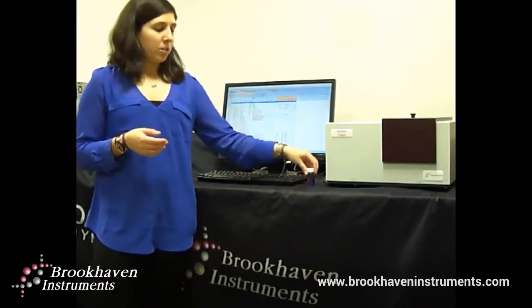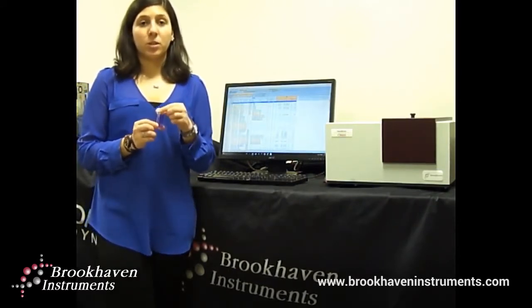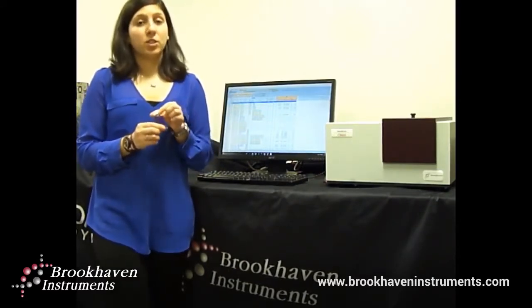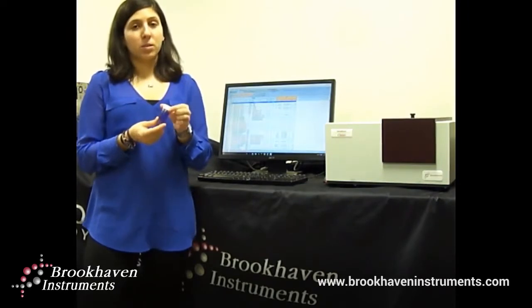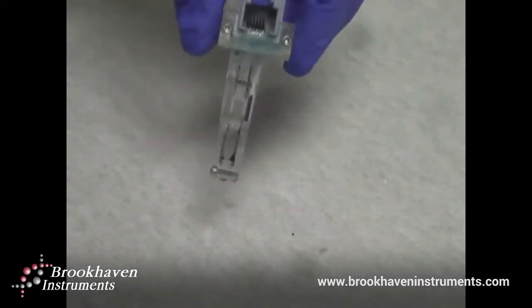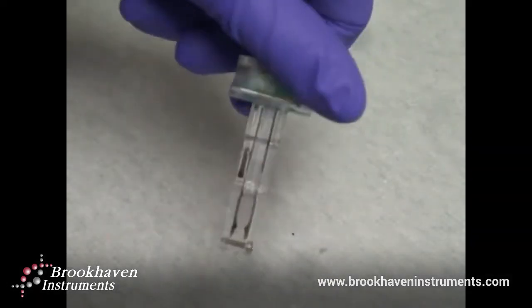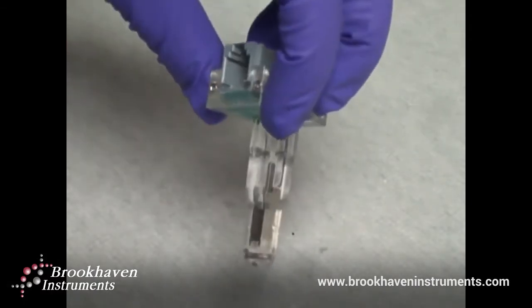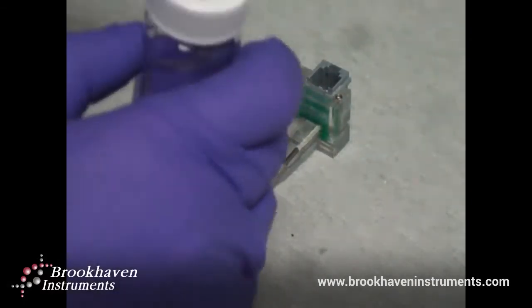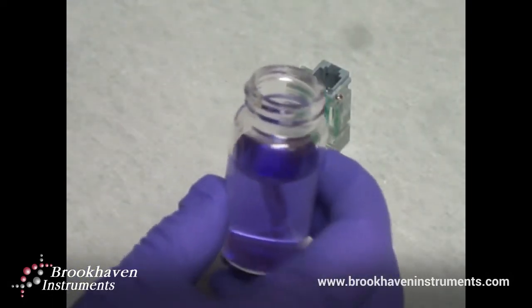Prepare a sample. First, I will be measuring a negatively charged reference material we call ZR5. It is a suspension of ink particles that gives a repeatable value for zeta potential. Take a zeta potential electrode like this one. This electrode can be used to measure the zeta potential of any aqueous suspension. We also offer an electrode for organic samples.